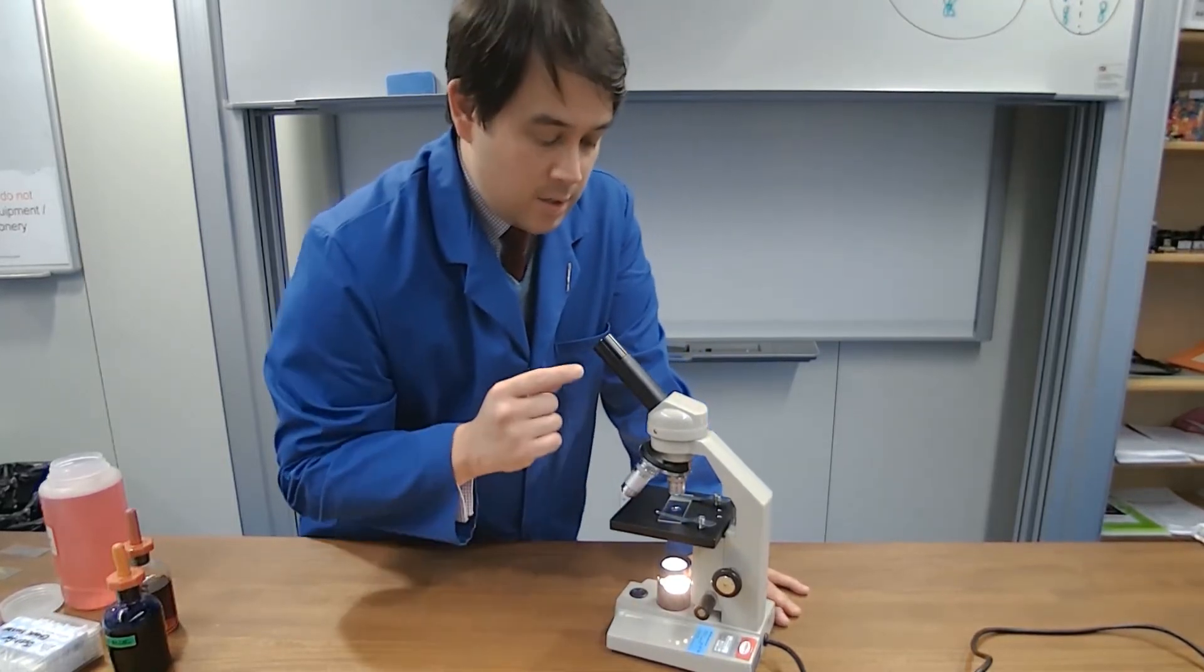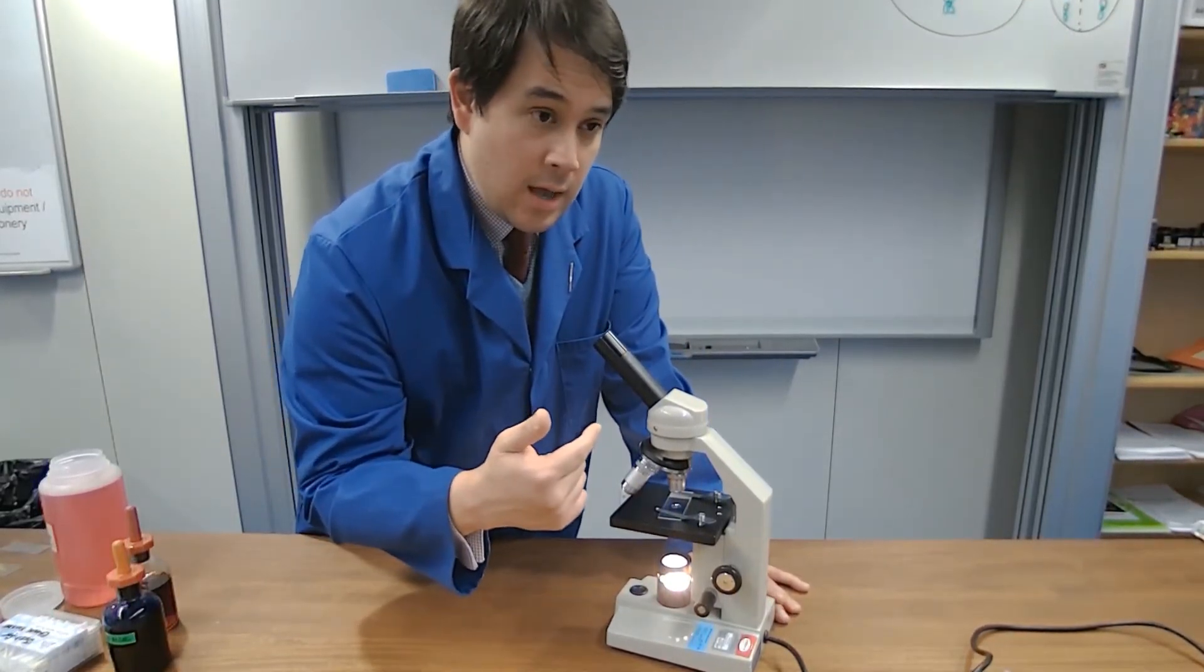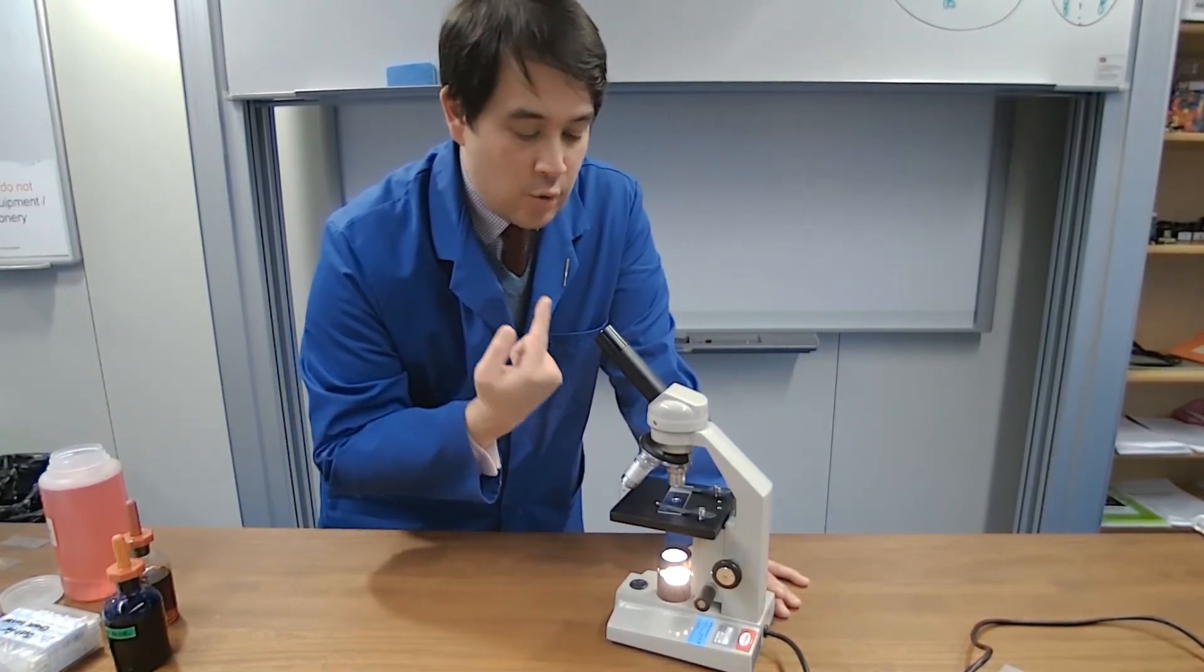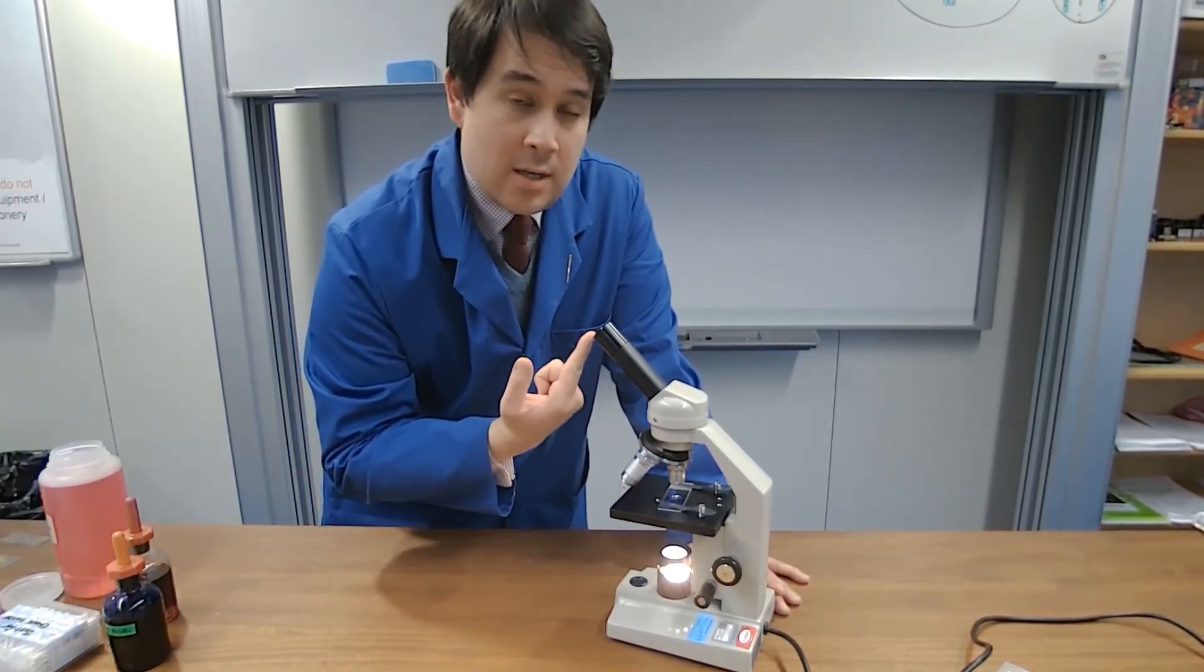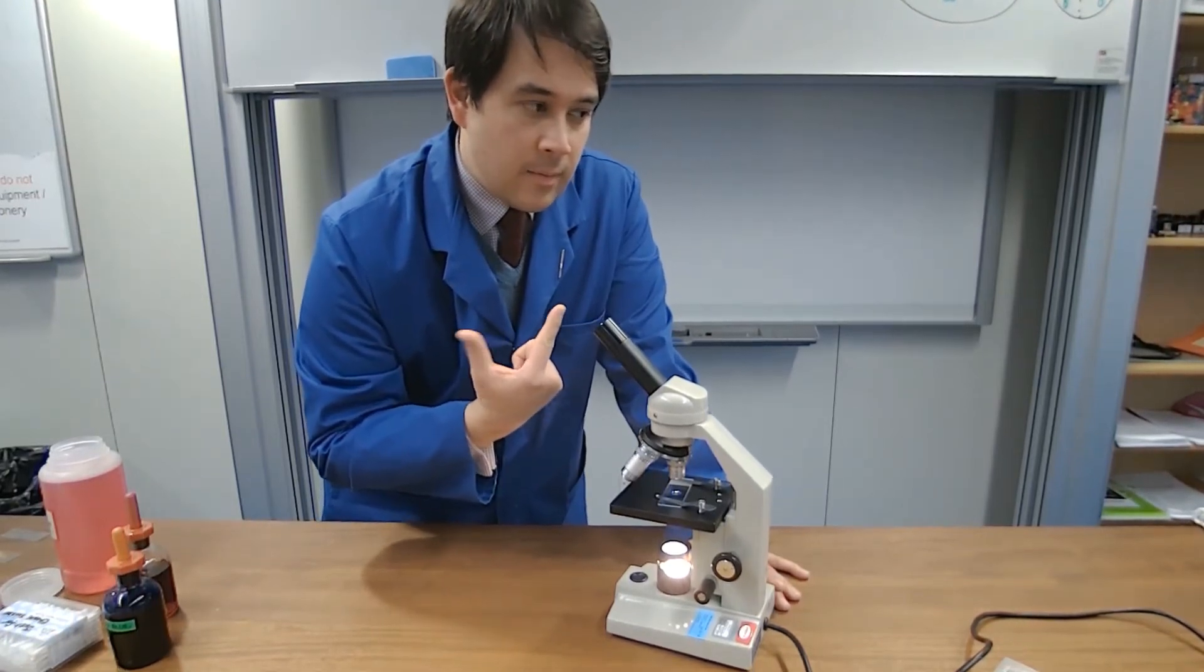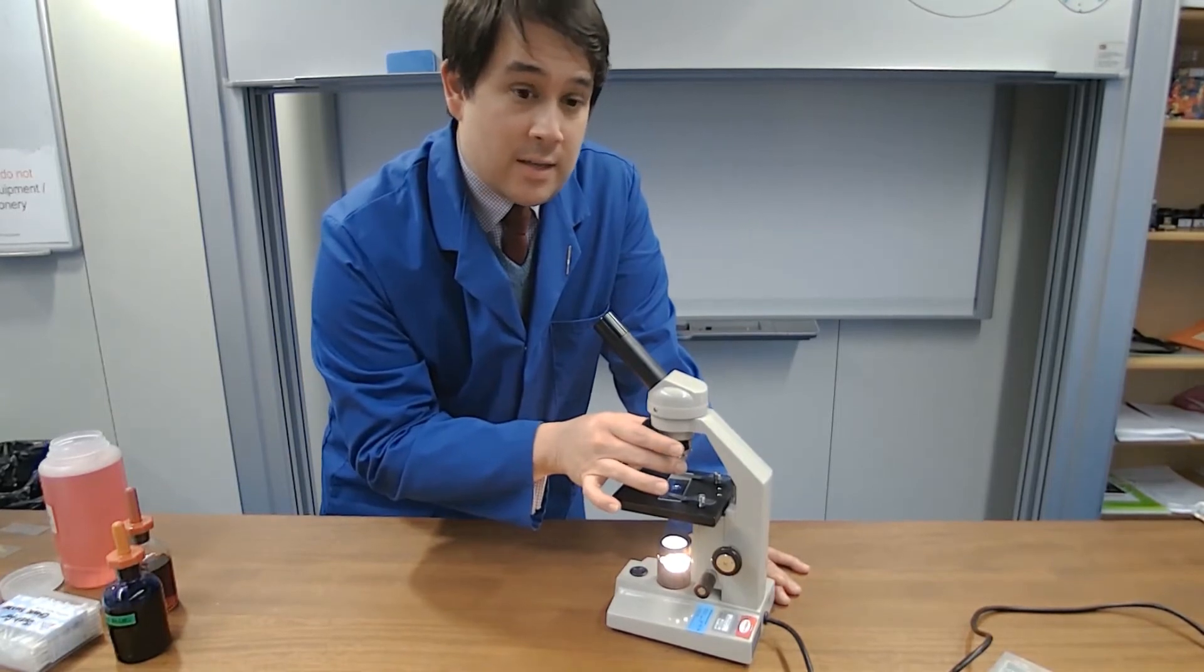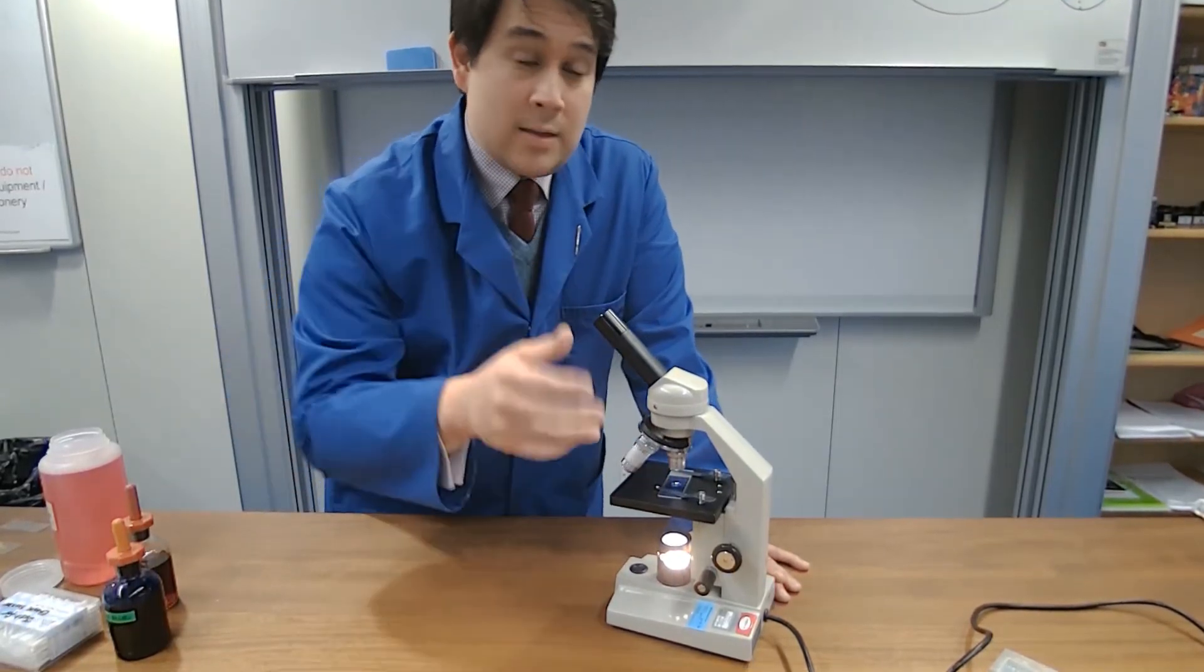I will now attempt to locate the image and then we'll use a phone camera, I hope this will work, in order to show you how the image changes as we go along and then show you why we would use different objective lenses and how we come to the best image possible.